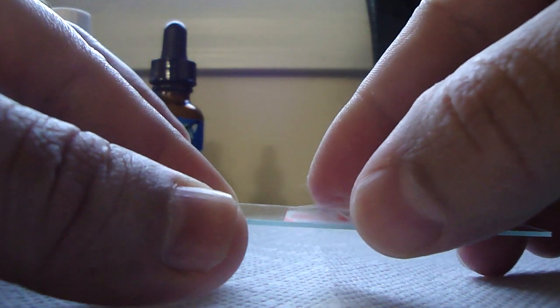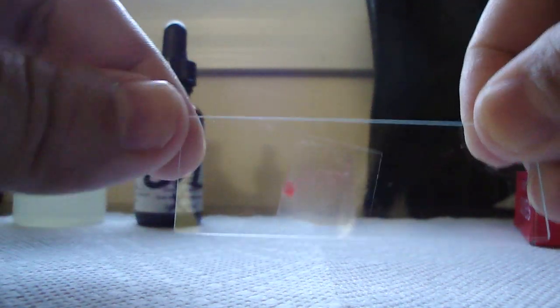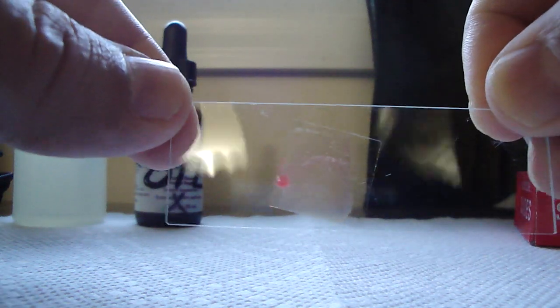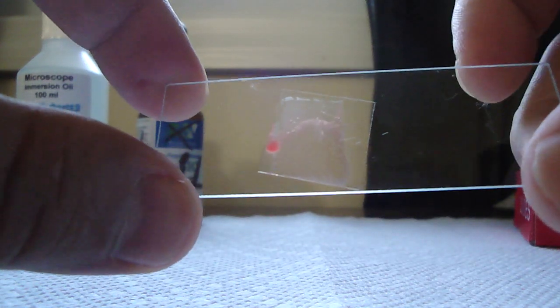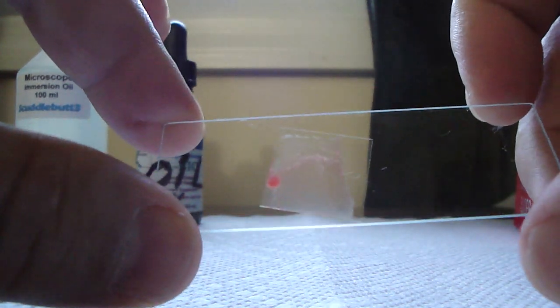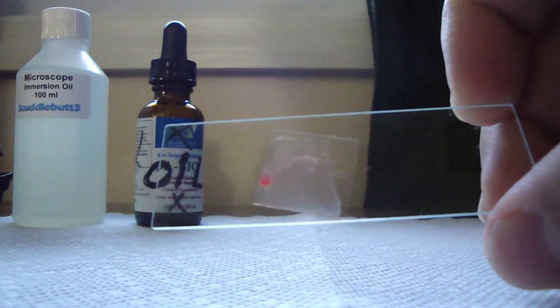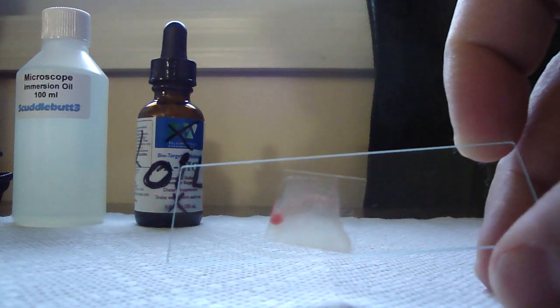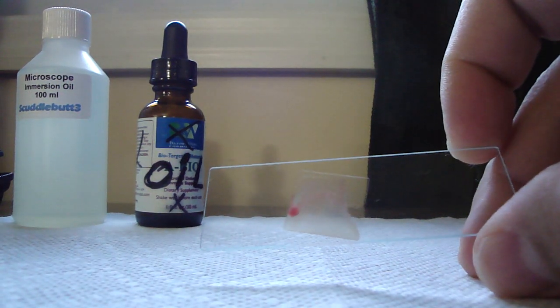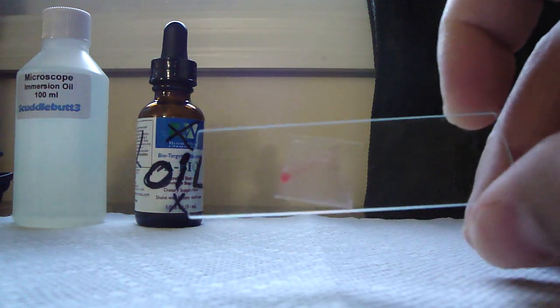I'll put the glass slide on top. You've got to be careful so it doesn't move around. So that's a nice slide right there. Let's see if I can pick this up on camera nicely. Now here comes a secret. If I were to leave this like this, first off, if I were just to check this on the 100x objective plus the 10x eyepiece, 1000x, I wouldn't be able to see much. I see the cells that turn out blurry, so you need oil.